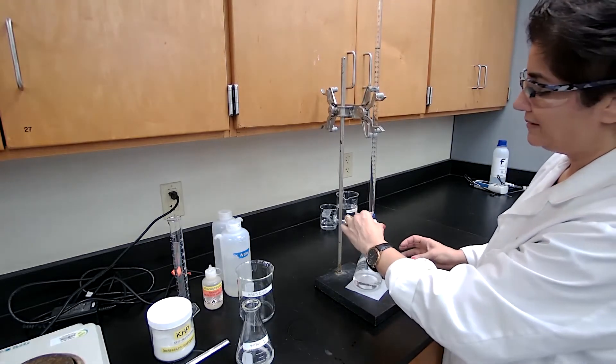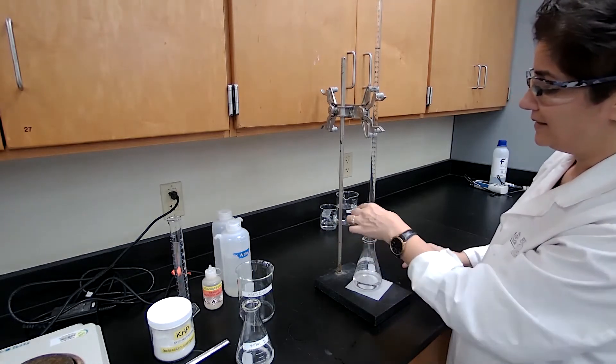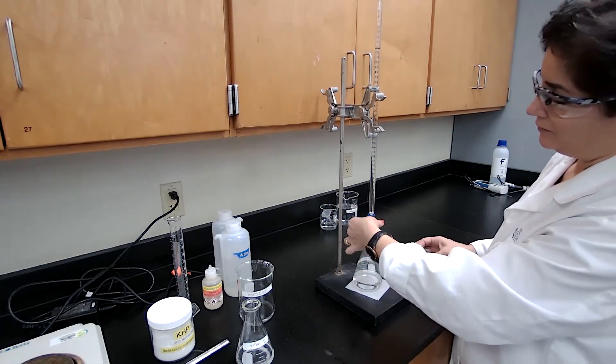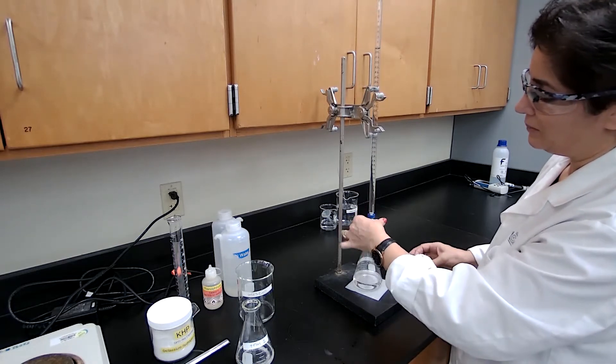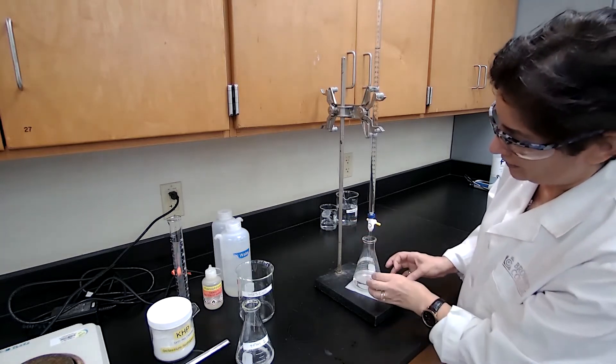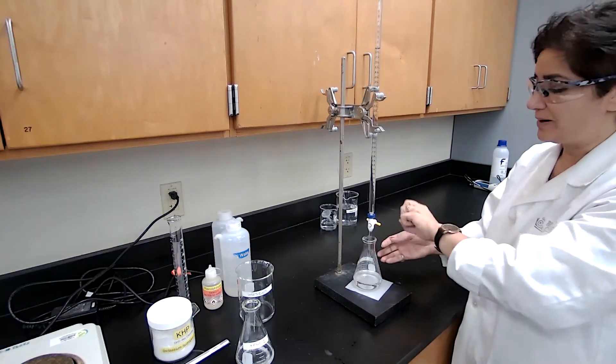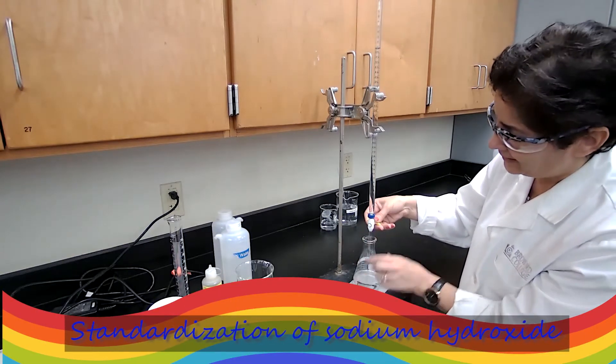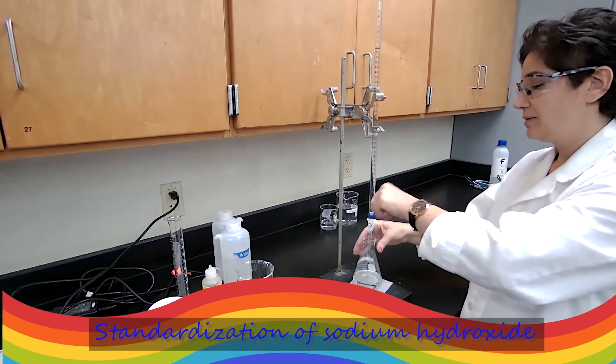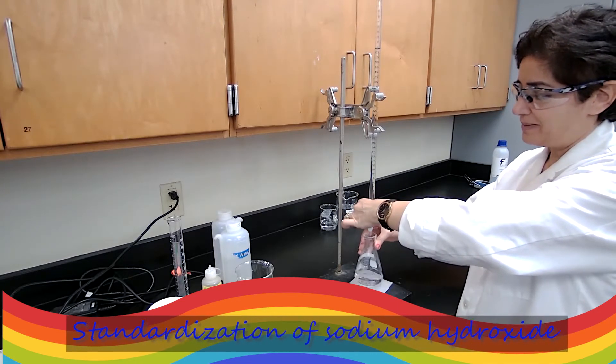And holding the stopcock with my left hand, in this position with my fingers, I hold the stopcock and control it. But since I don't want to block your view from what's happening, that's why I move my hand so you could see it. I'm trying to get you a better view of the experiment, what is happening.